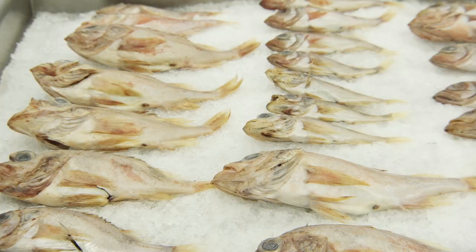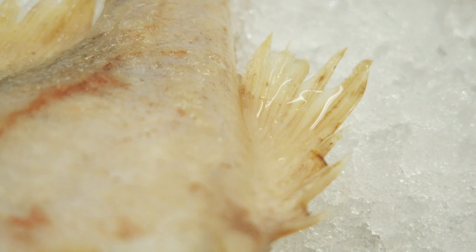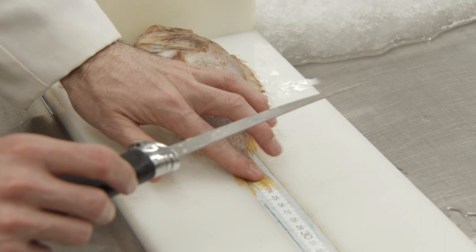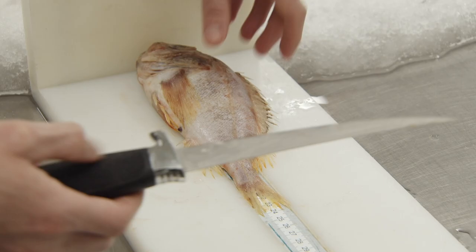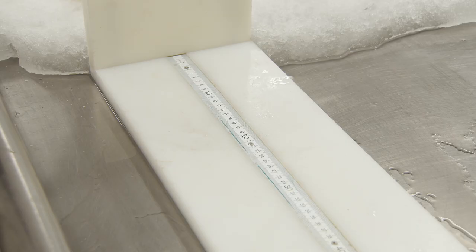First, you take a random sample of 50 fish. These fish will be used for the counting of rays and will be noted in the left columns according to their number of rays. Make sure that the mouth is closed and touching the board. We will record the fork length — in this case, 24 centimeters. We will then count the number of anal fin rays: one, two, three, four, five, six, seven. And then we will sex internally. In this case, we have a male.